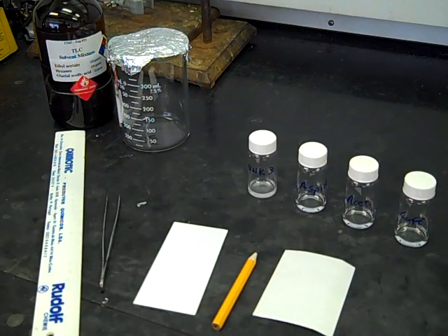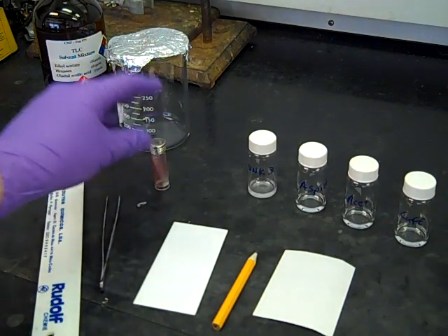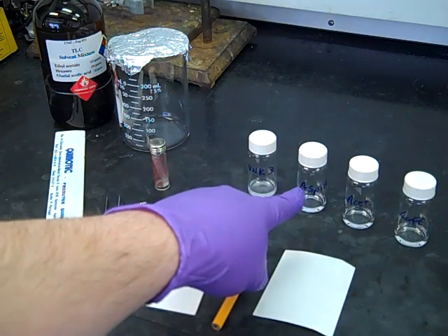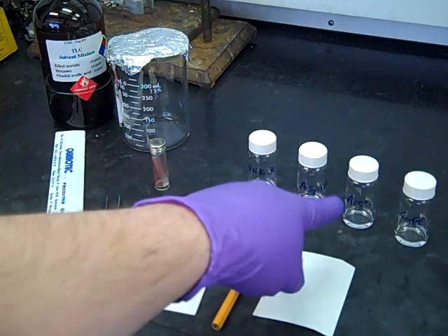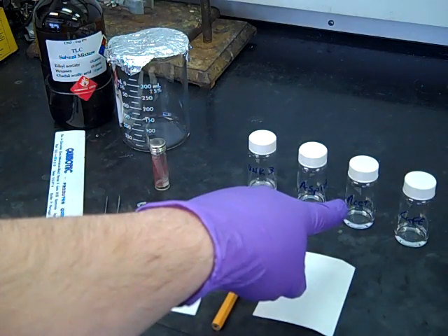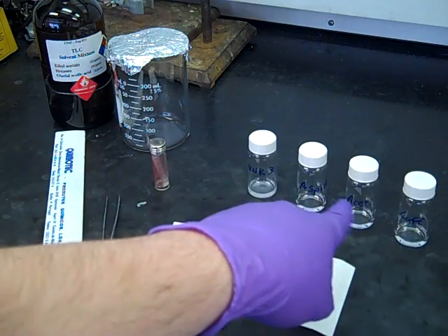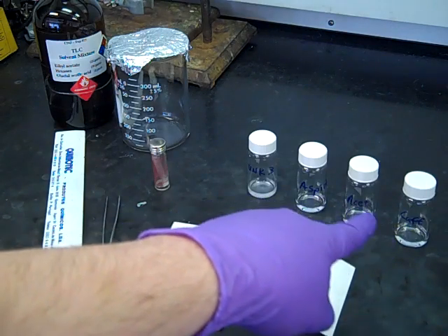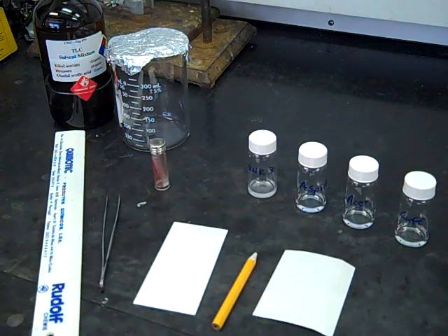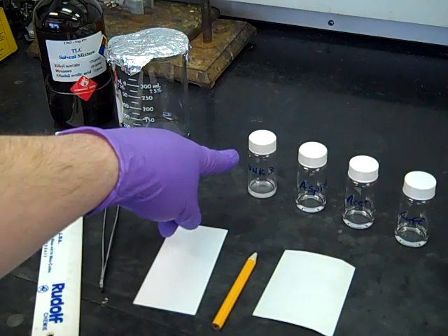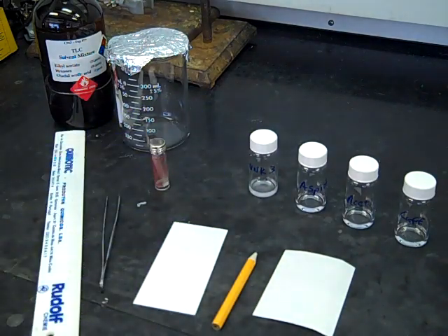We've got four vials. Three contain the standards: aspirin dissolved in methanol, acetaminophen dissolved in methanol, and caffeine dissolved in methanol. All three should be liquid solutions that you can get from the reagent hood. You're going to take some of your unknown drug mixture and dissolve that in methanol yourself.